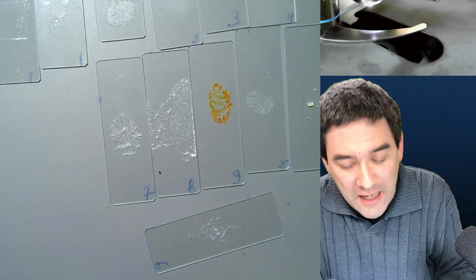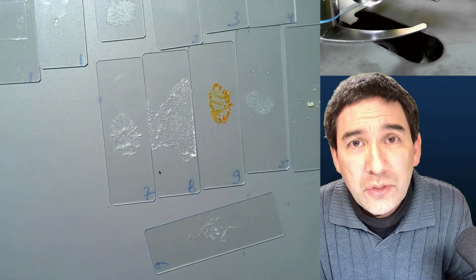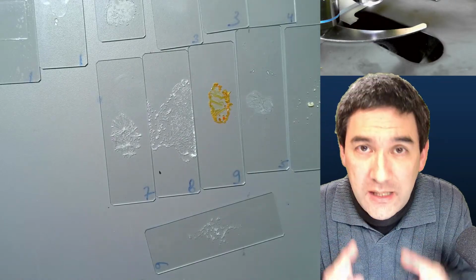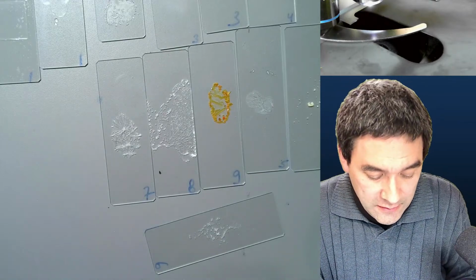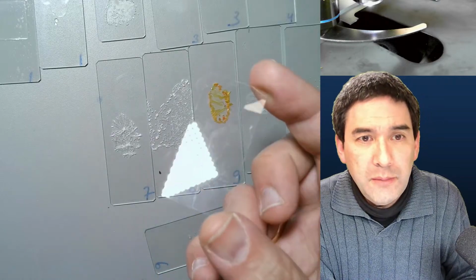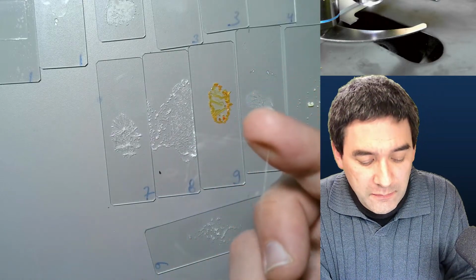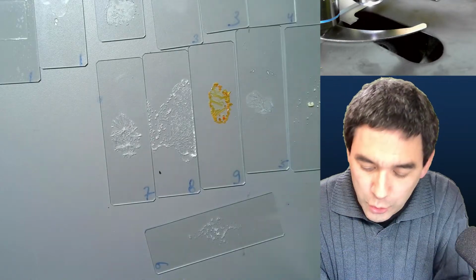So what you need is, actually I would like to put a cover glass on top here, but I would like to make sure that it's still surrounded by air. So I want to make a dry mounted microscope slide, and I'm just going to use those gigantic cover glasses now. Look, they're pretty big, okay? And there is now the following problem, and I do have a suggested solution for this.